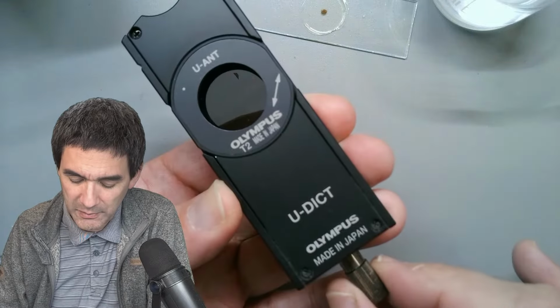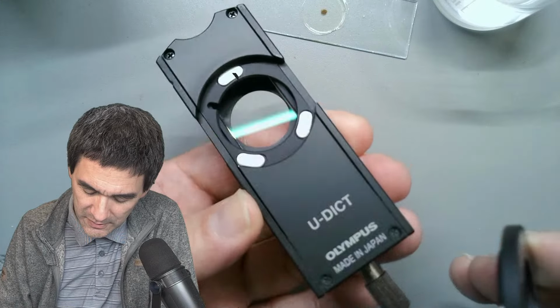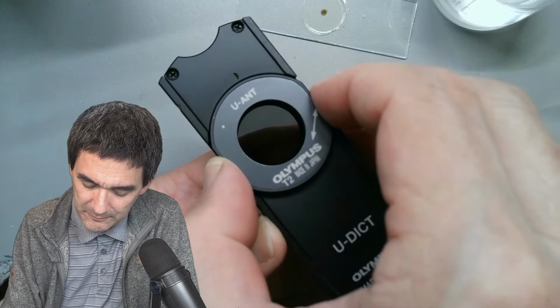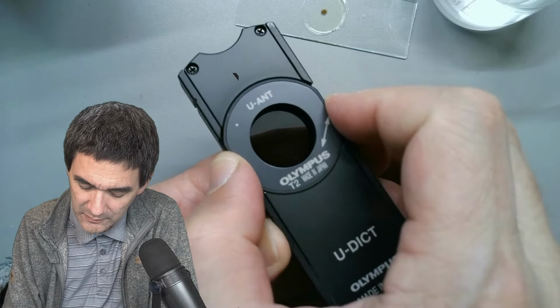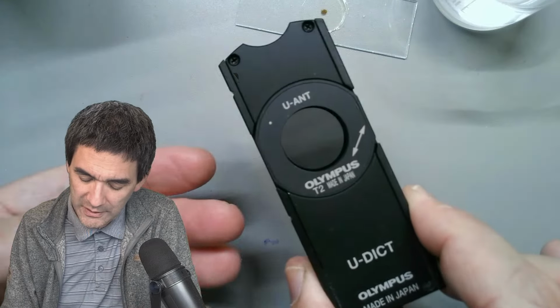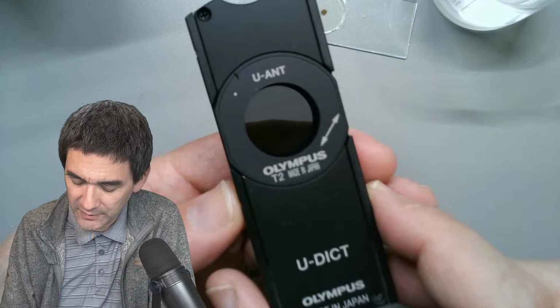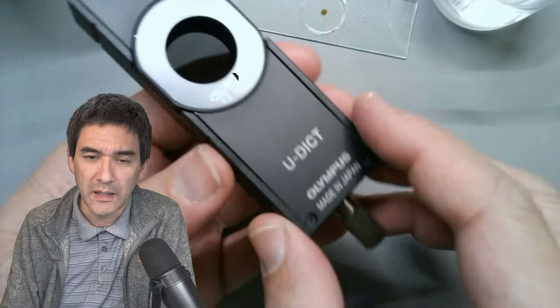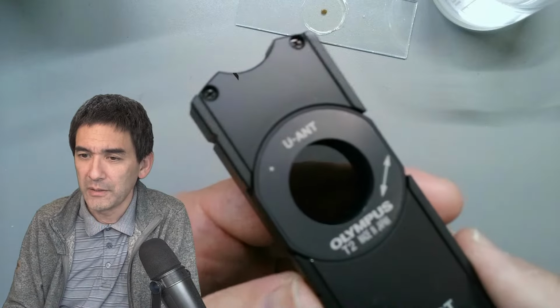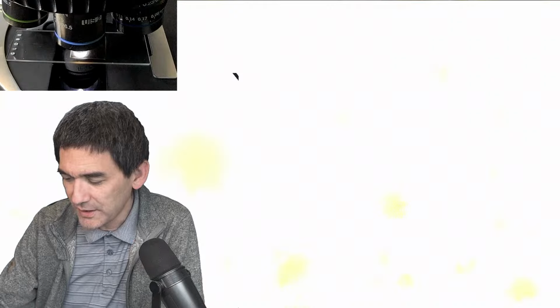When I turn this here, something in there is kind of moving. Yeah, this is by magnet. It's something in here that's moving slightly. And this causes the change in color. There's a polarizing filter in here and whatnot. Yeah, a Wollaston prism. So this is the thing that I'm turning to change the color. I'm going to put it back again. Okay, and you know what? So that you can actually see how this looks.